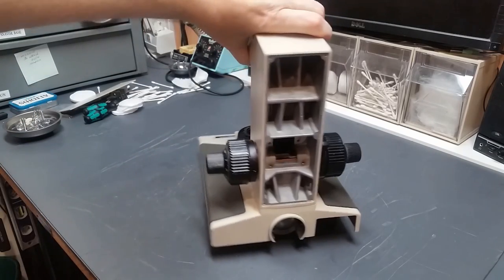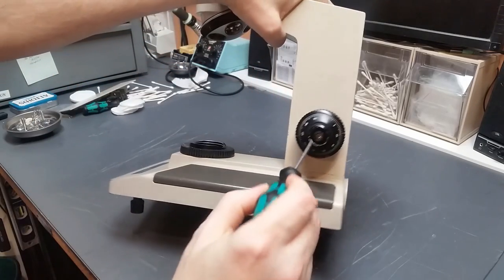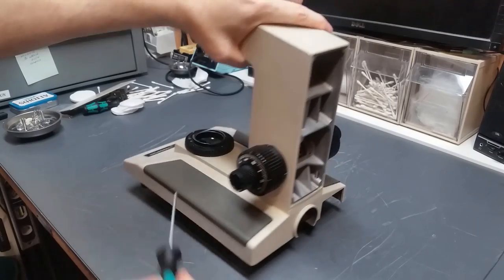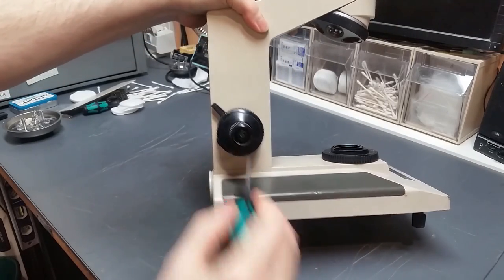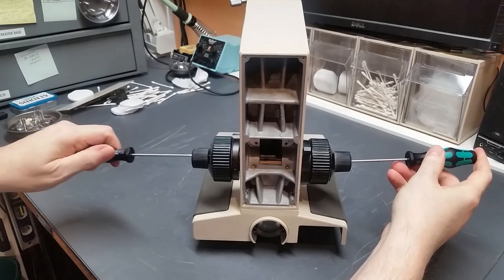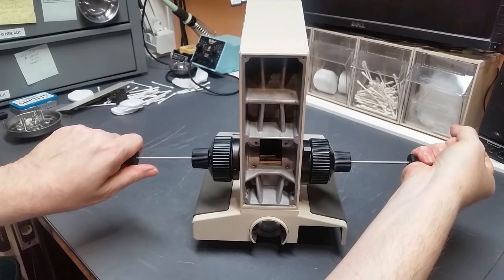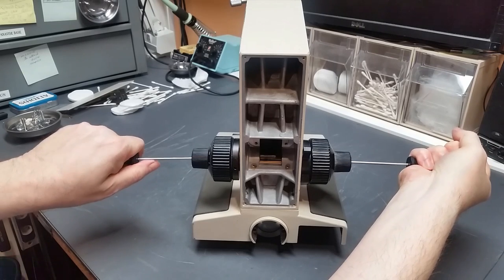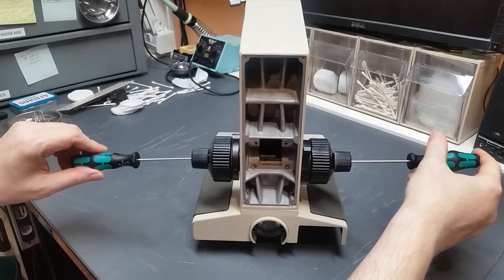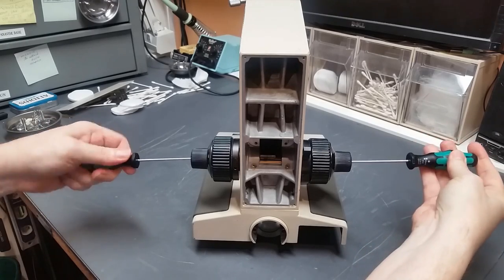Okay, so now that we've got that, what we have to do is actually remove the knobs. And in each of these knobs inside here, there's a little hex cap screw. It has a 2.5 millimeter hex head on it, and that's present in both knobs. And so the way you take these knobs off is you put a 2.5 millimeter hex tool in each knob. Hold one stationary relative to the other, so that you're basically turning them against each other until something breaks loose. It'll be one side or the other that breaks loose. There's no guarantee which side it'll be, but generally it's this side, and I think that's the one that came loose here. So I'll continue loosening these things.